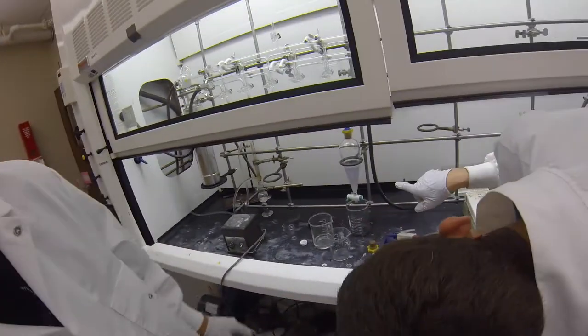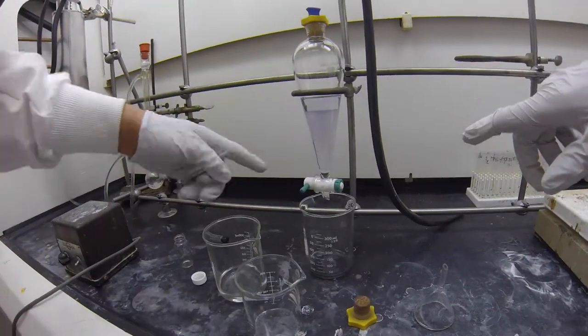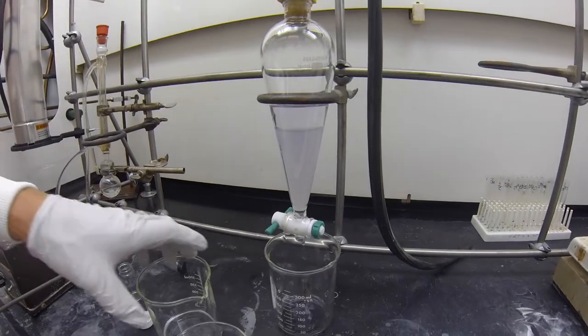What are you doing? I'm just trying to separate some layers, you know, I've got an aqueous layer, the last two.